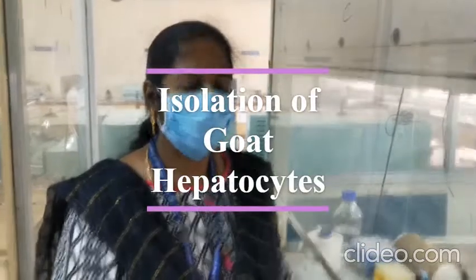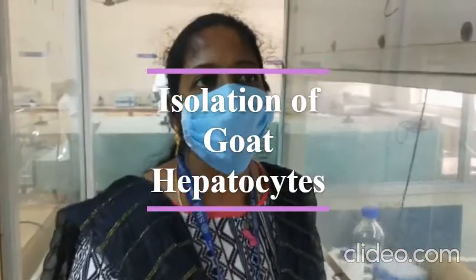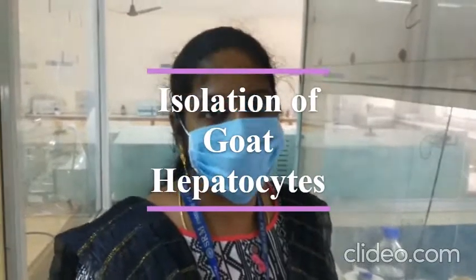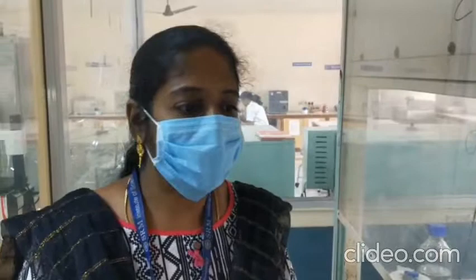This experiment is about the demonstration of the isolation and culture of hepatocytes. Hepatocytes are the cells obtained from the liver. The liver could be of goat origin, mouse origin, or any other origin.